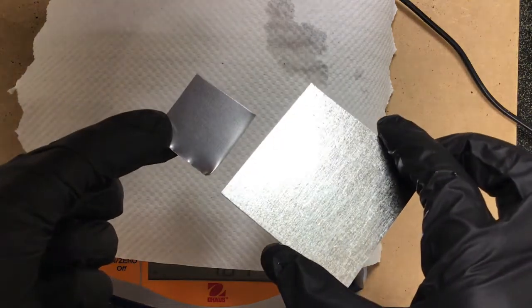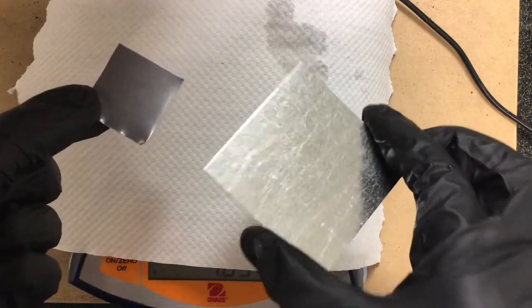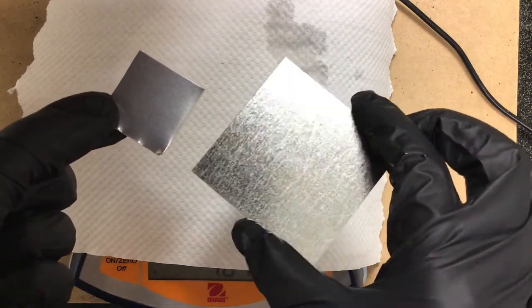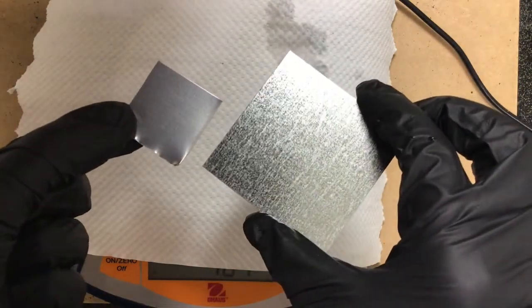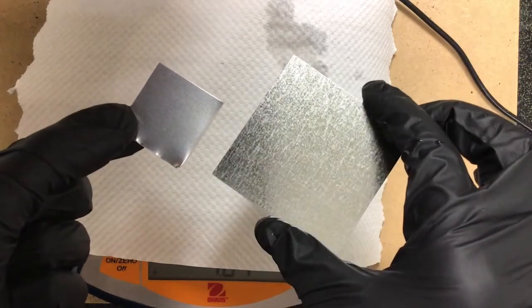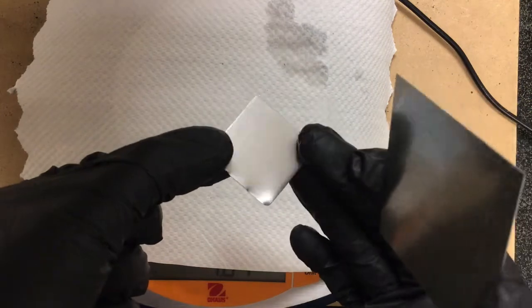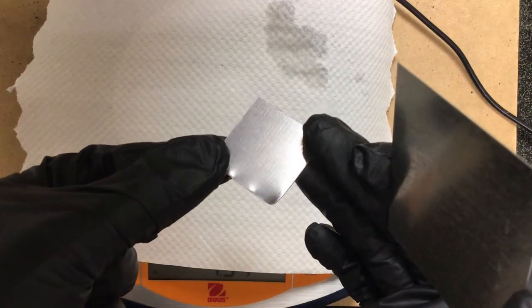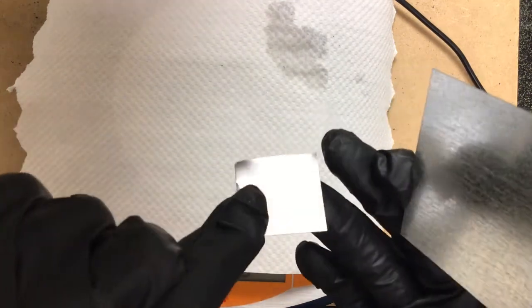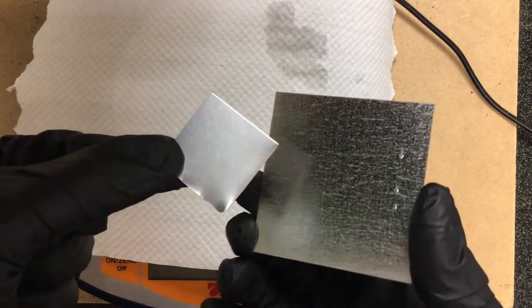Okay, now that we have removed most, if not all, of the zinc coating from this piece of galvanized iron, I just wanted to have you look at a side-by-side comparison looking at the surface. So this was an original piece of that galvanized iron and you can see it's very shiny. It has good luster, but also you can notice that the surface looks rough in comparison to the reacted piece. So now, yeah, there is still some shininess there, but it's not nearly the same. And then also the actual surface of the piece has been altered. It seems like it's smoother and not quite as rough. So that's just a side-by-side comparison just for your information.